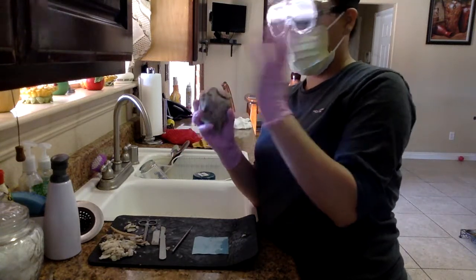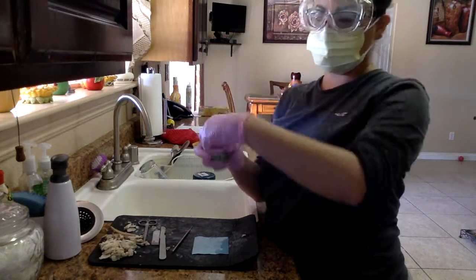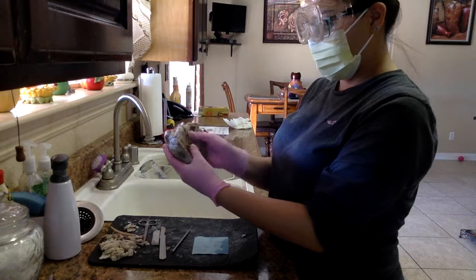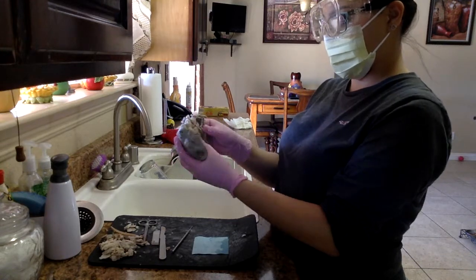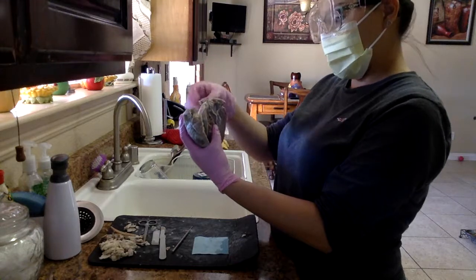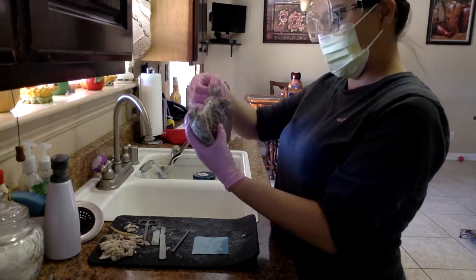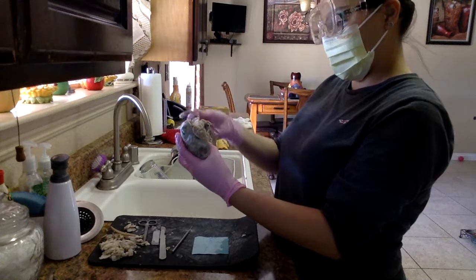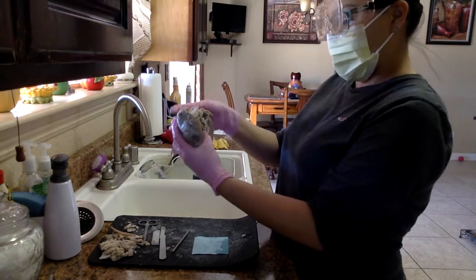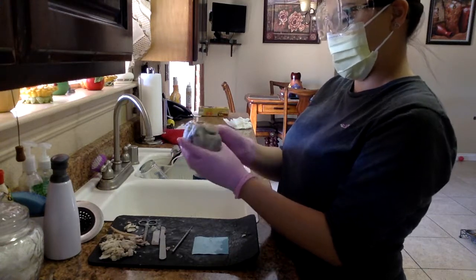If I were to run my finger through, it would go through this portion here, okay? And then we have the aorta here. I butchered that pretty well, but it's still there. And so that's the aorta. And like I said before, this is the inferior part and this is the anterior part.